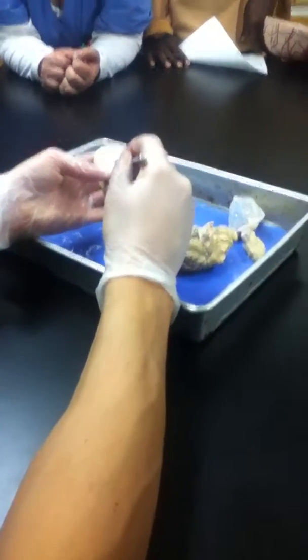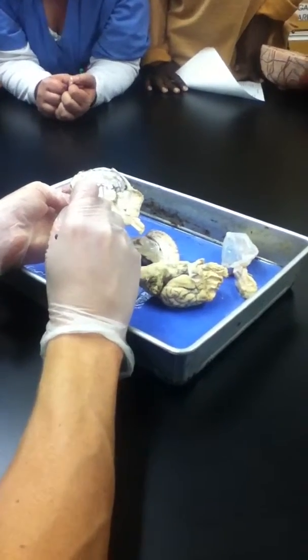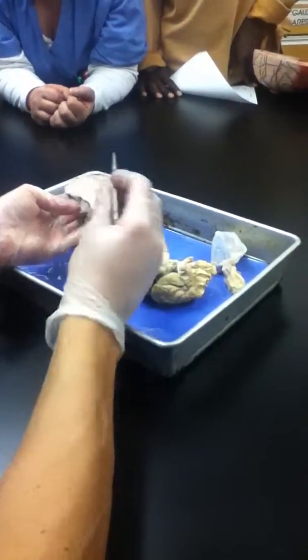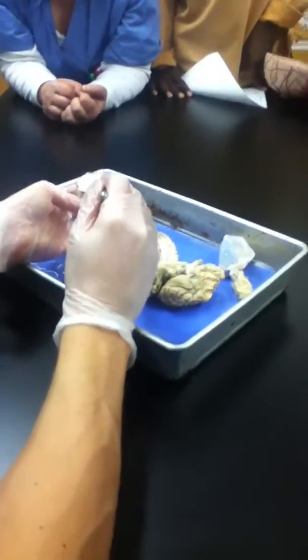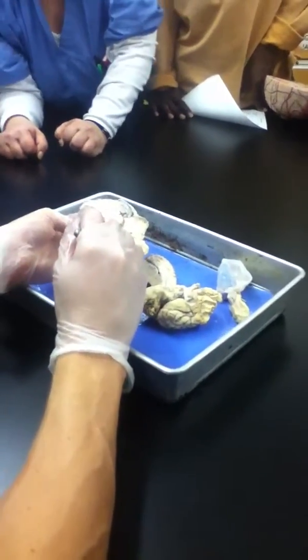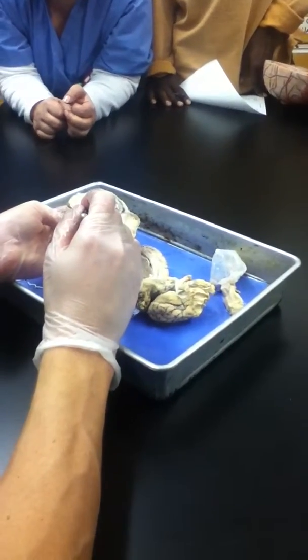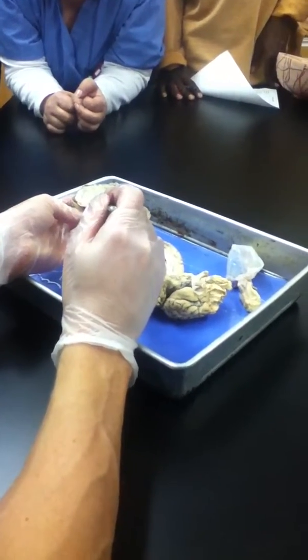The thing is, I wanted to also see other structures around here. For example, note the distinct round shape here. What is the round structure at the very top of the brainstem? Not part of the brainstem, but what sits on the brainstem. The diencephalon sits there, and what's the round piece of it? The thalamus, yes. So this round structure here is the thalamus, which means if that's the thalamus, what must this region be? Hypothalamus. It is not a clear distinction. If there's a pin smack in the middle of the round structure, it must be thalamus. But if it's kind of well far down from the middle of that round structure, it must be referring to the region of tissue that is now the hypothalamus.